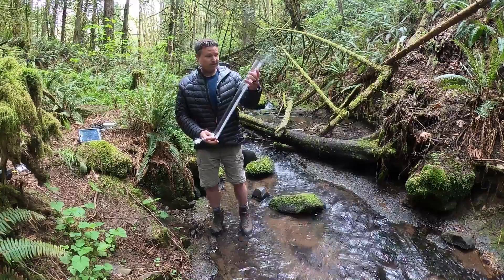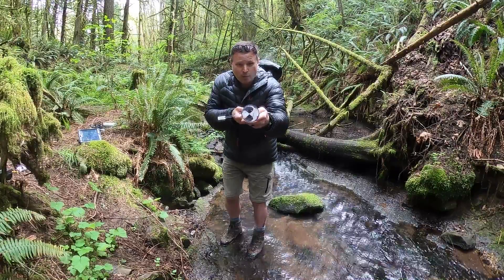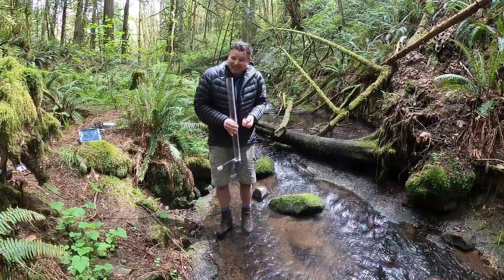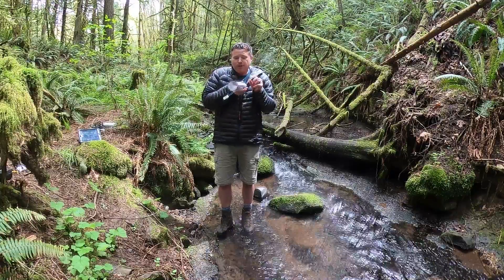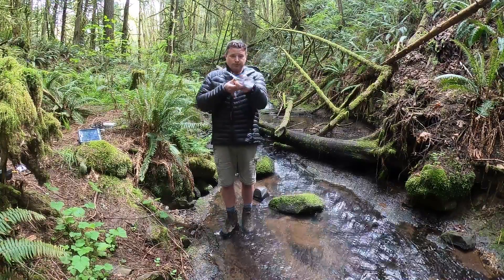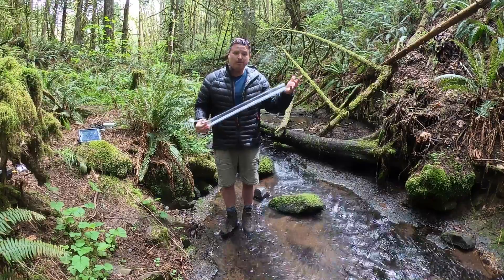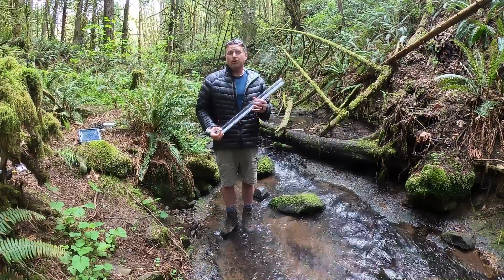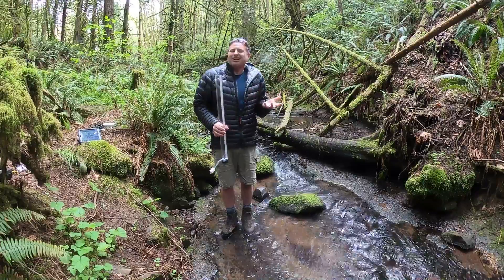A much better method is something you could almost construct at home. If you look right down the tube, you'll notice there's a black and white disc in the bottom called a Secchi disc. Typically we lower that into a water column like a lake on a rope with a measuring tape attached. When the disc gets so deep that you can't tell the difference between the white and dark part, you measure that depth and it gives you the clarity. Clear lakes in the Cascades — you can see all the way down 20, 30, 40, 50 feet. Crater Lake is a good example. In contrast, the Columbia River during a heavy rainstorm has a lot of sediment turbidity.